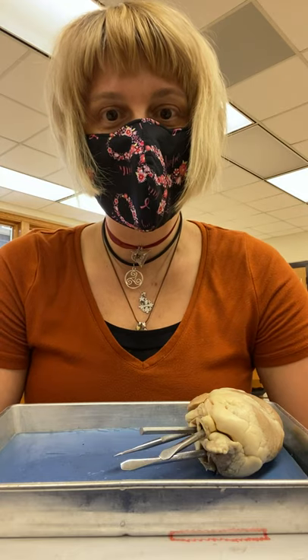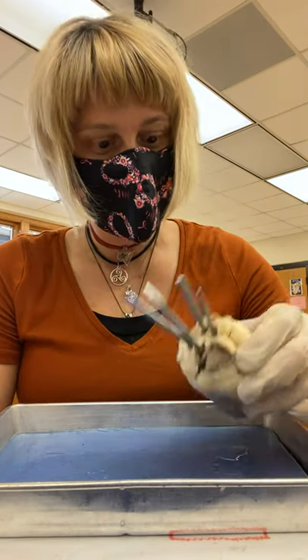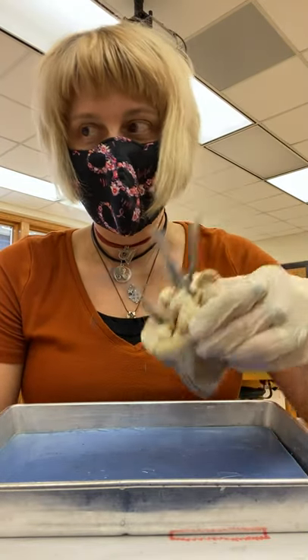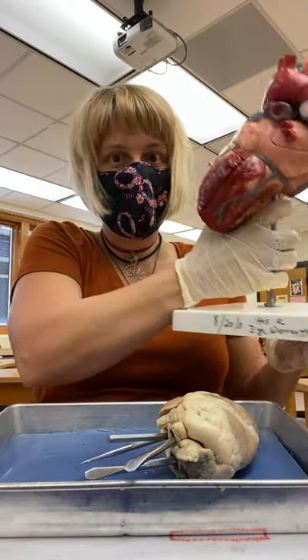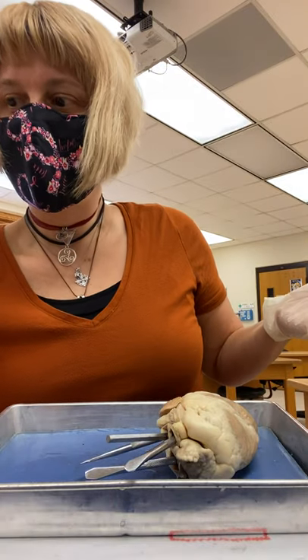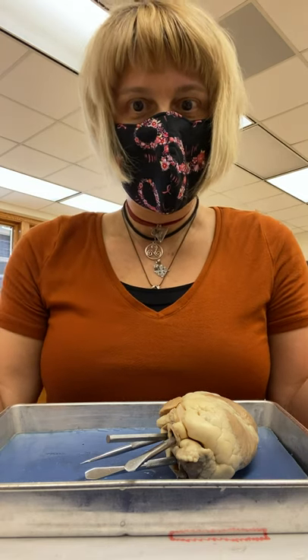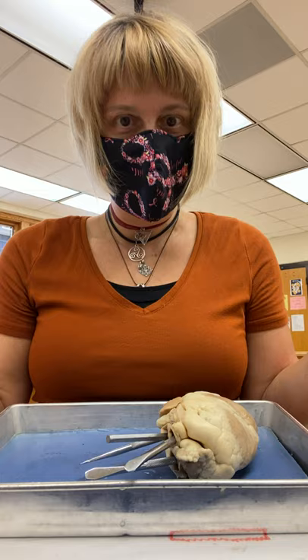However, I wanted to do a heart dissection today, and this is a sheep heart. We're going to go over the heart, and then we're also going to look at the lab model and compare the two together. First, I'll start with the heart dissection, and then I'll review all the structures of the heart with our lab model. Let's begin.